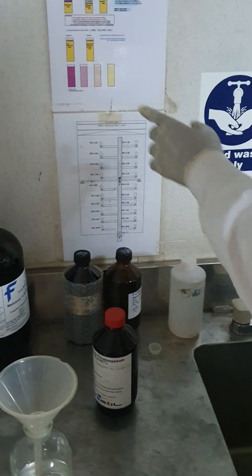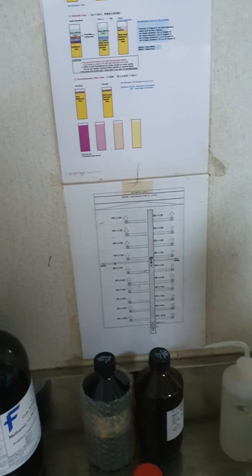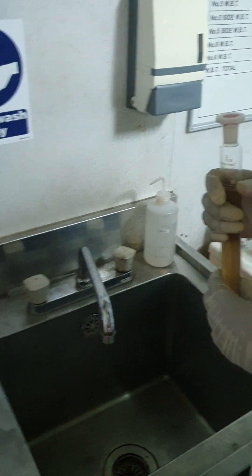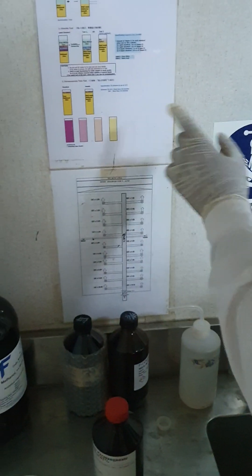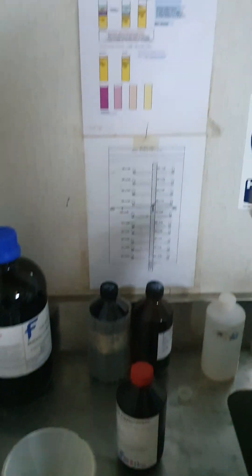Initially you have to wash this one very carefully, don't put your hand and better you prepare one more also. I mean, one more means one of the standard one. You will give the pure methanol and 2cc of potassium permanganate and then you put in the refrigerator.